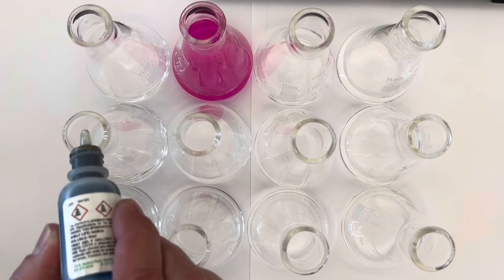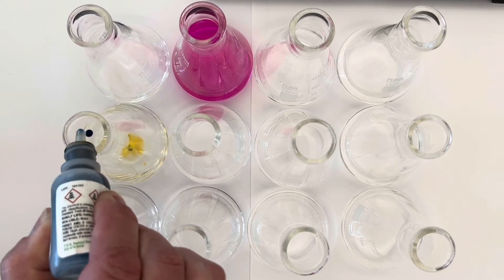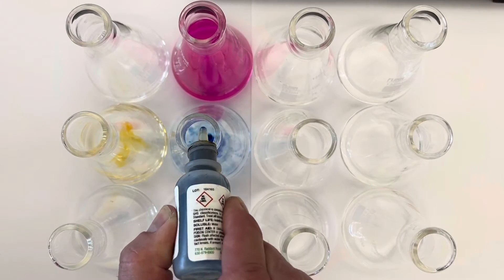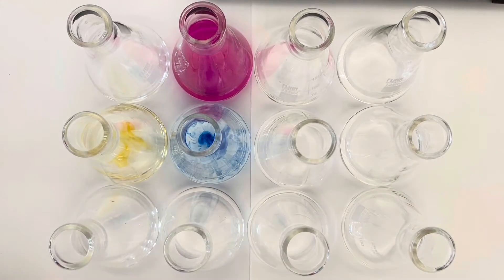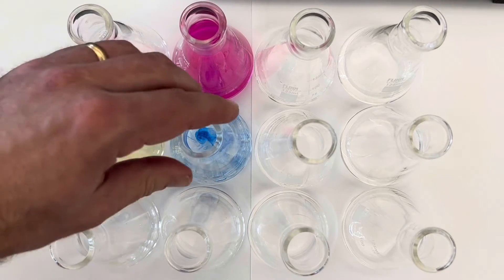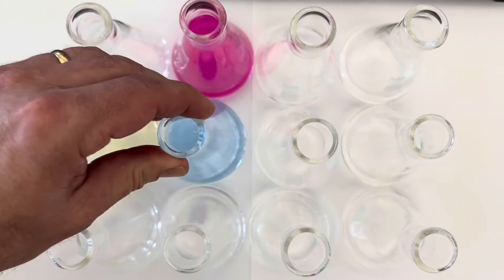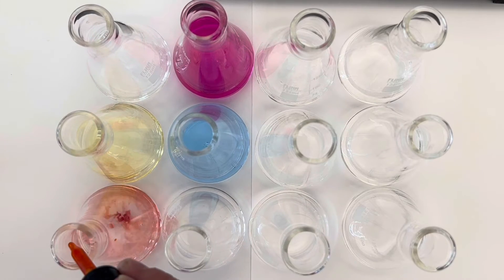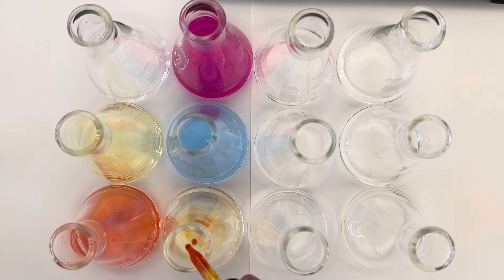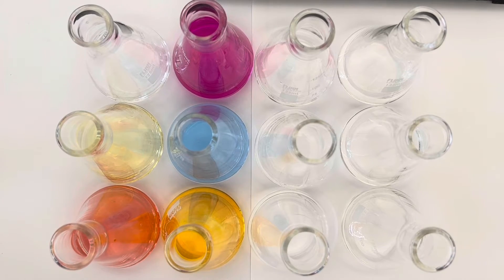Bromothymol blue, you'll see when it goes into the acidic solution, is yellow, but in the basic solution, that is blue. Let's just mix them up just a tiny bit. Methyl orange is more reddish in acidic solution and more yellowish in basic solution.